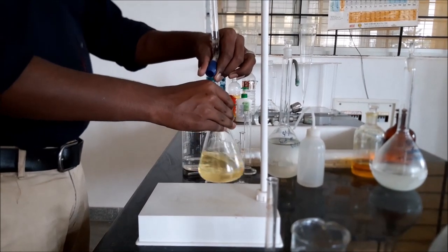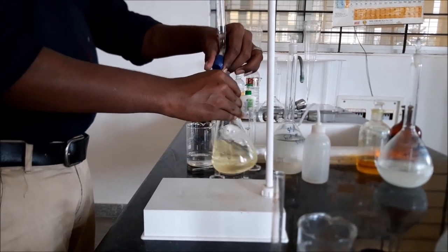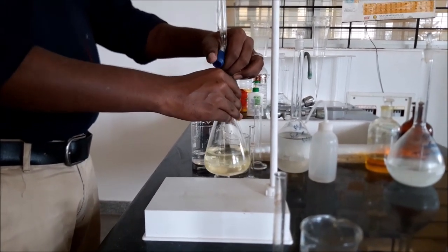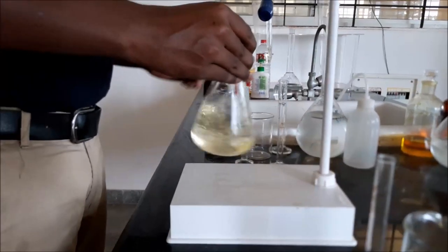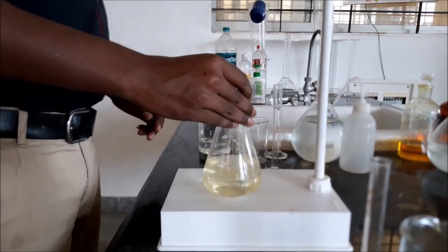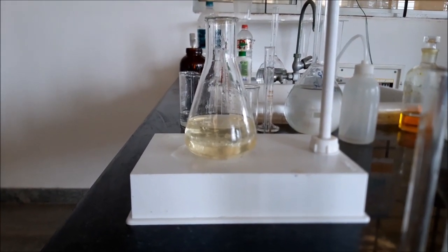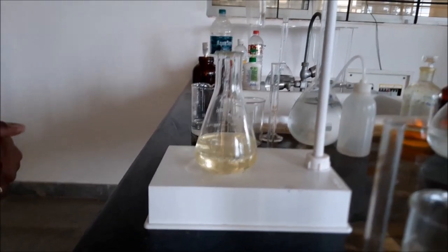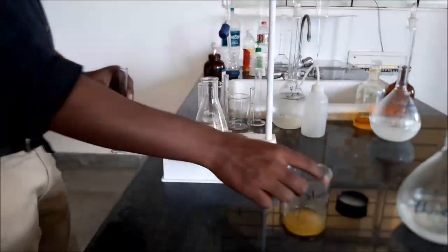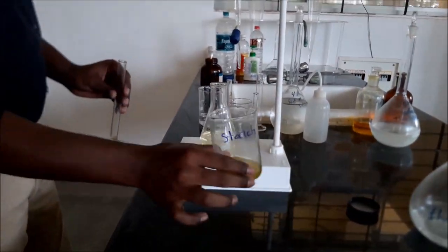As you see from dark yellow color, it has changed to pale yellow color. The color has faded out, so after this add the starch.